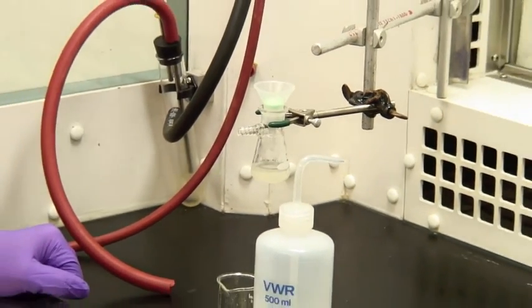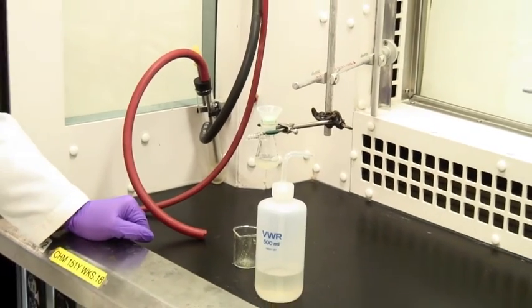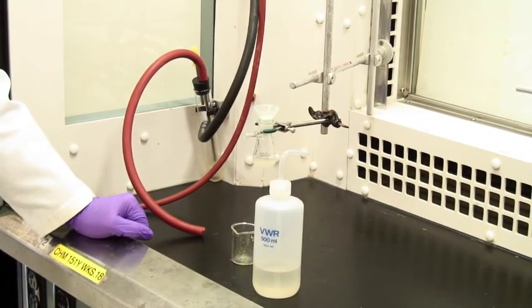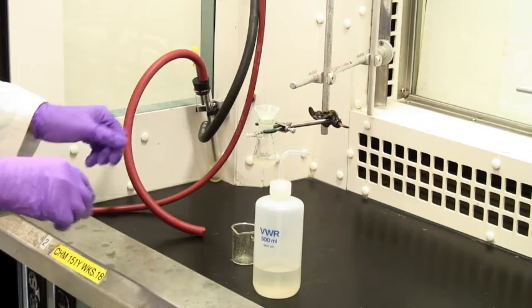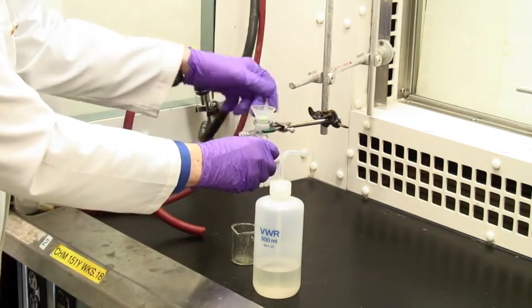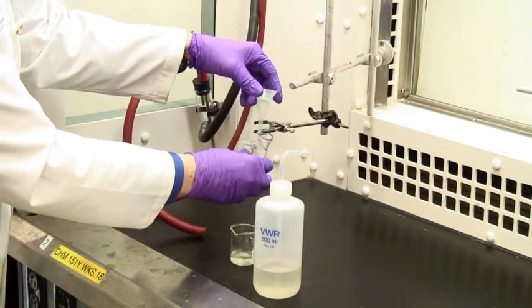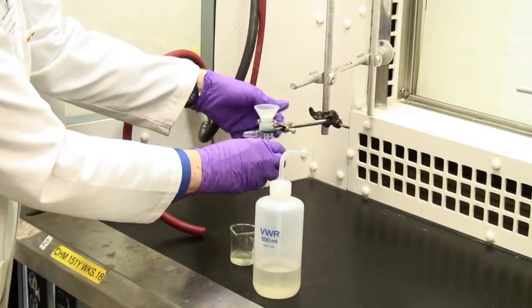Washing may or may not be part of the protocol, but once you've finished passing liquid through the filter, you may want to let it sit on the frit and dry a bit. In this case, dump the liquid back out again, put it back in.